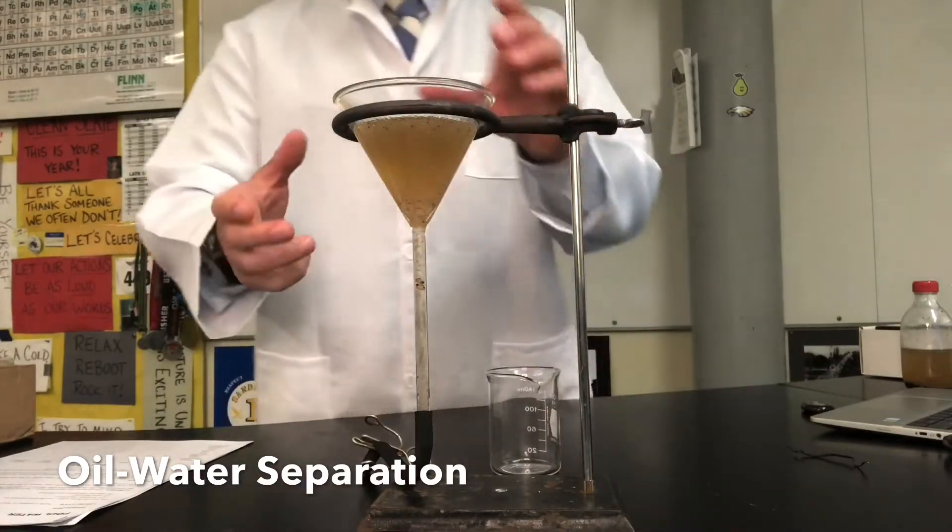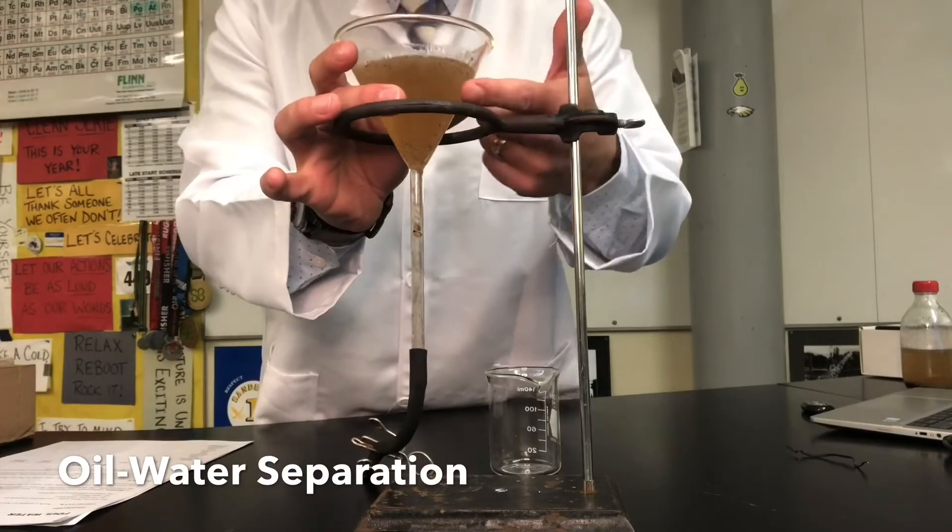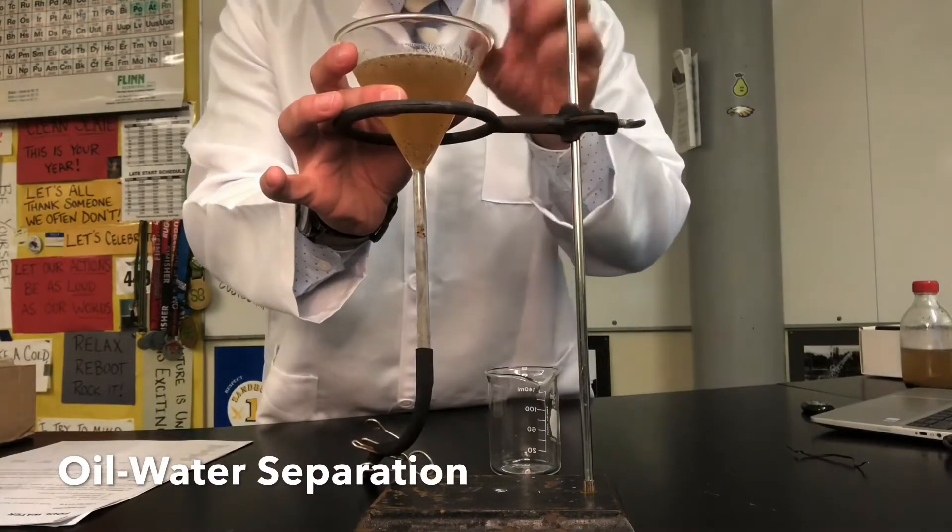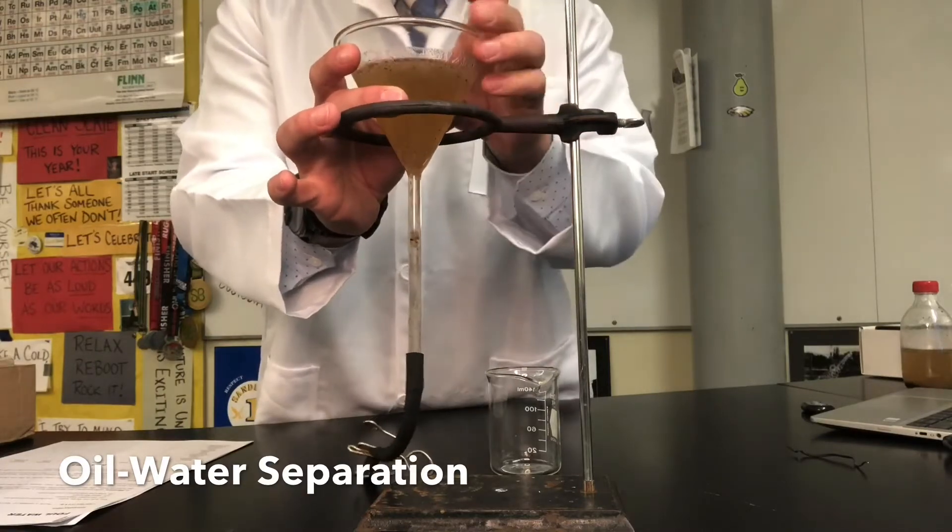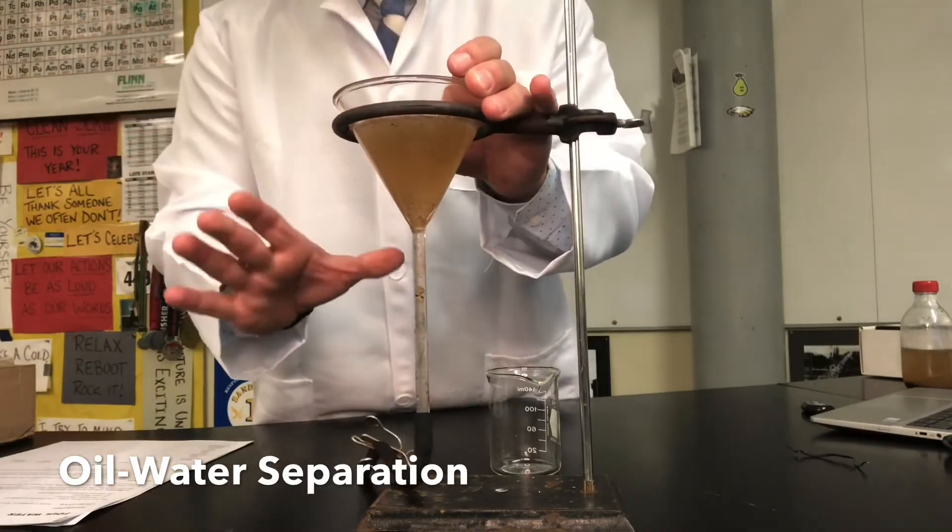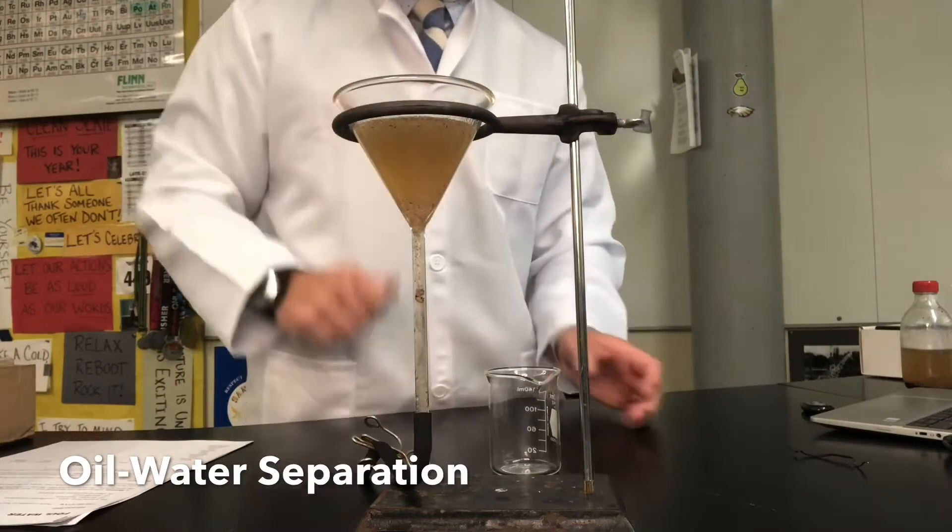All right we're back and now that we've let this set up it's probably hard to see from here but at the very top there's a thin layer of oil and like bubble globules of oil and underneath is still the dirty water. Now by no means is this water clean but we now have taken advantage of the oil rising to the top.